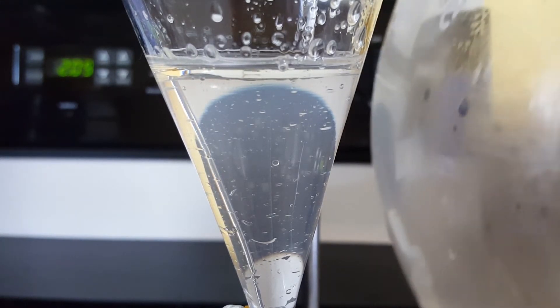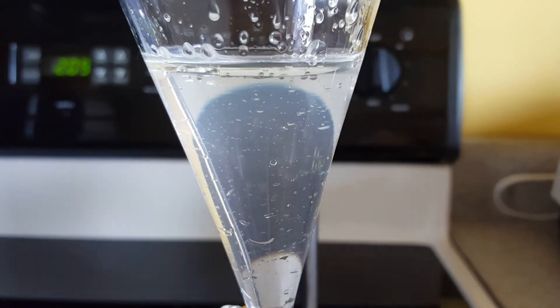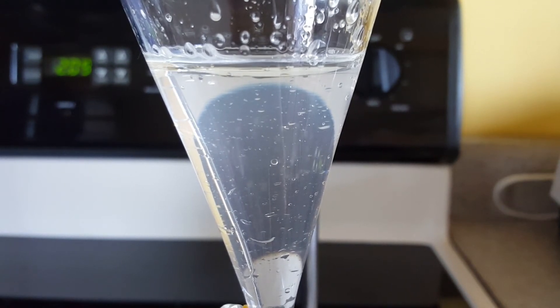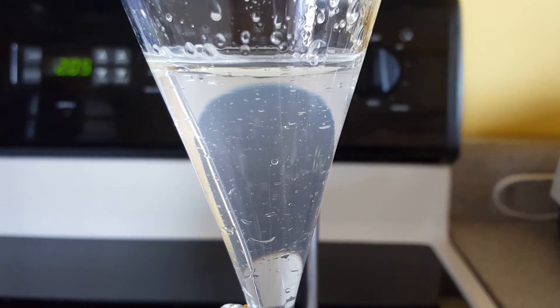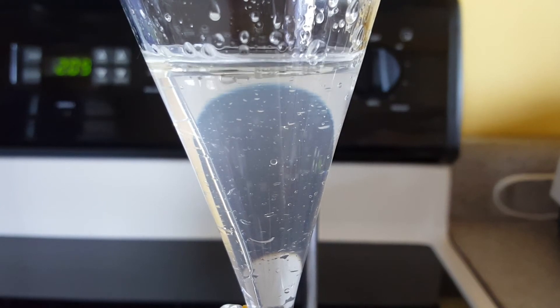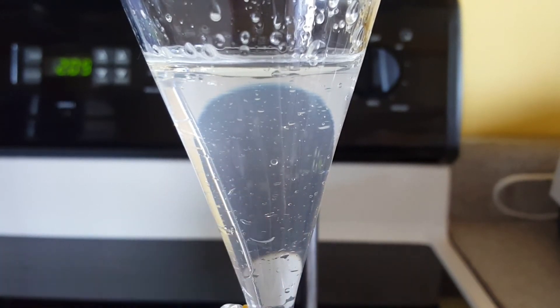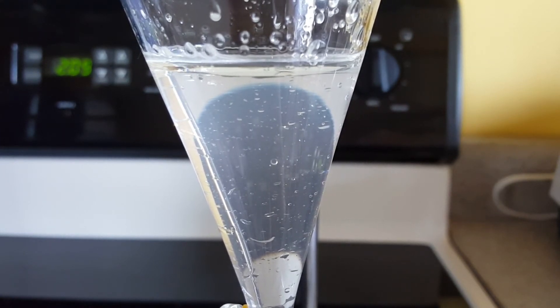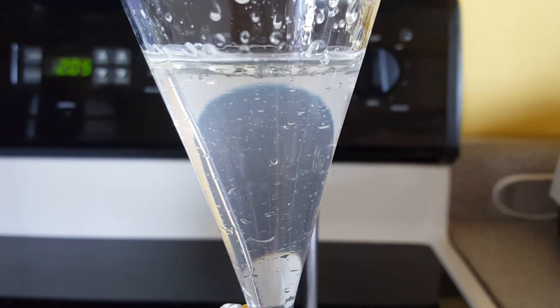I've observed the same thing on my other vessels. This flask that I used to collect the initial distillation also has these droplets, and as I move the liquid around in that flask those droplets wouldn't incorporate into the main body of the liquid. I think I will heat up this collected water phase in the collection flask, which hopefully will allow those droplets to become more fluid and come off of the walls and collect into one common phase.